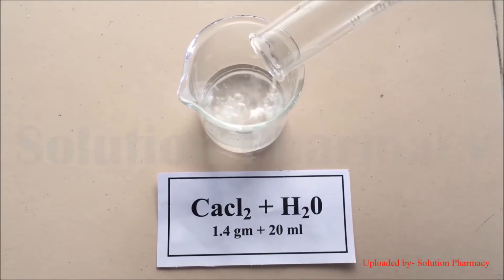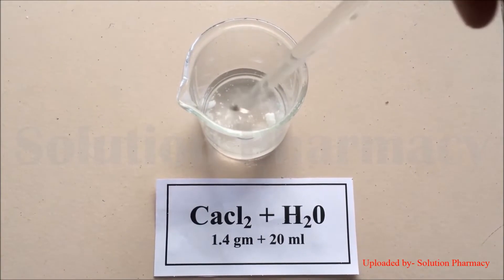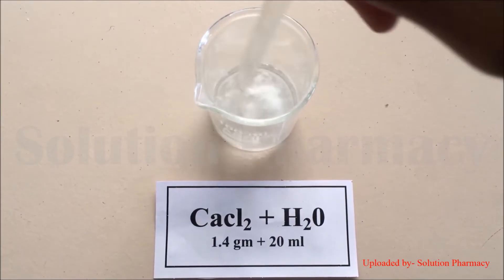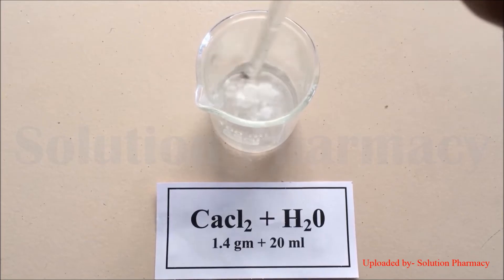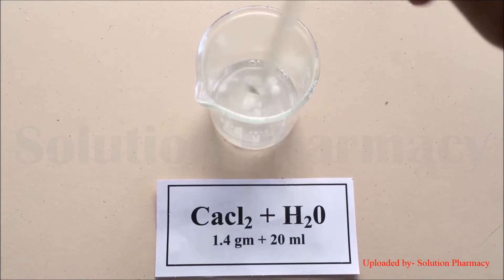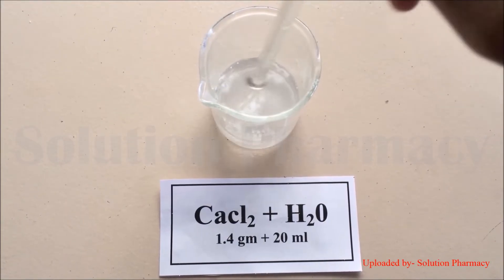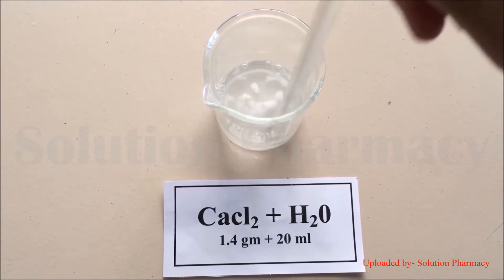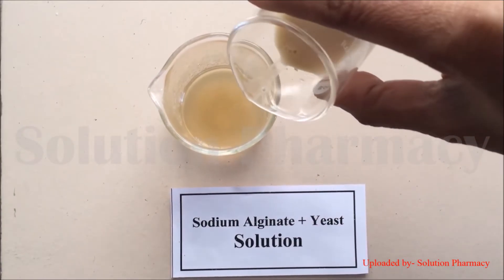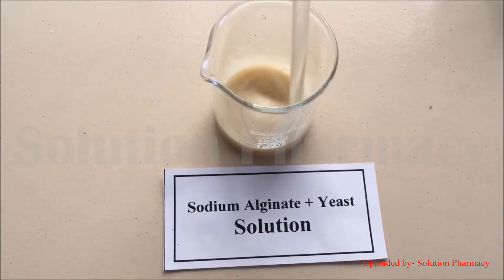After preparing the sodium alginate and yeast solutions separately, we prepare the calcium chloride solution. Transfer the calcium chloride into a beaker, add 20 ml of distilled water, and stir with a glass rod to dissolve it. After preparing the calcium chloride solution, the next step is to mix the yeast and sodium alginate solutions.